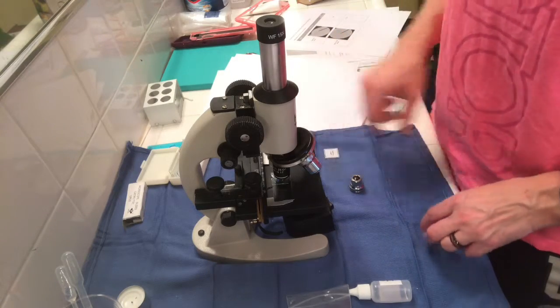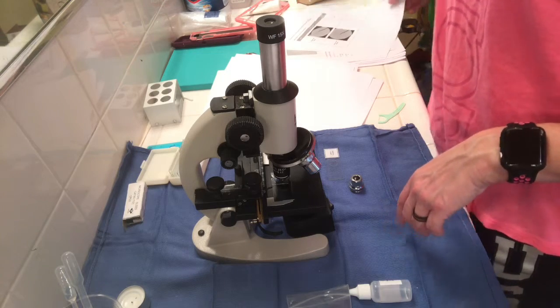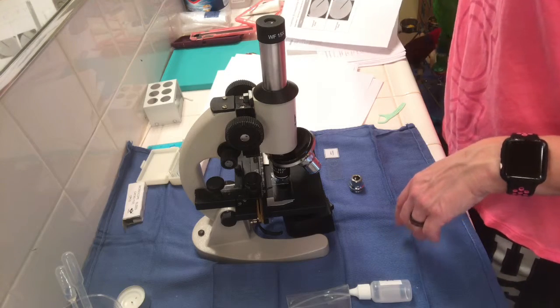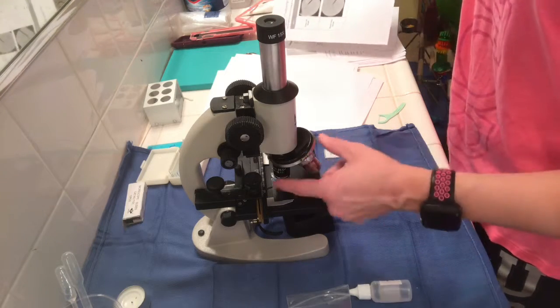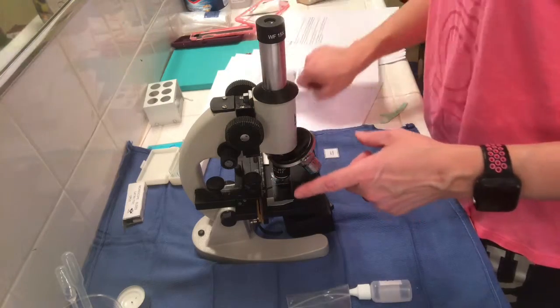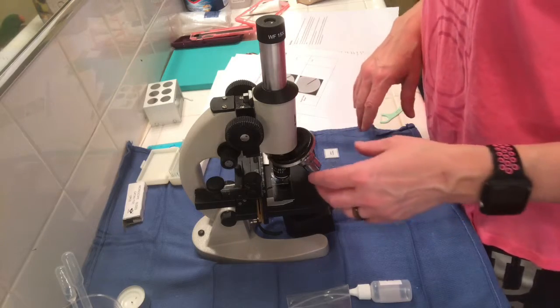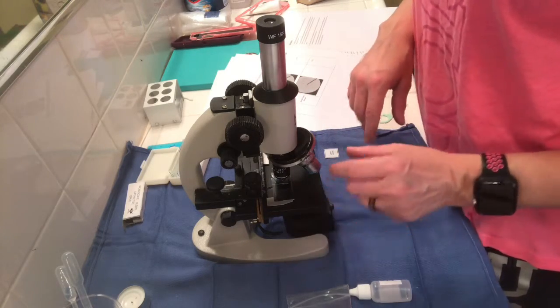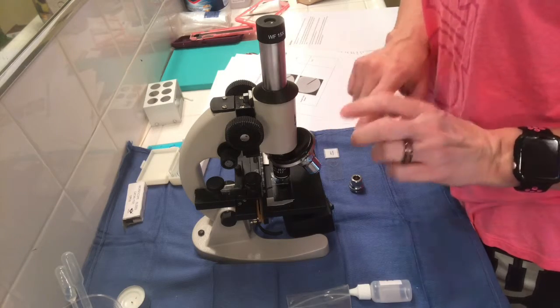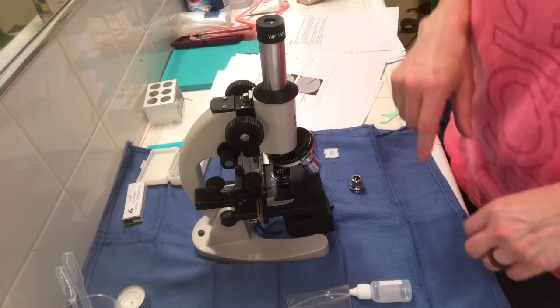because it wasn't stained, so it was hard to see my cheek cell smear and the dental tartar smear. So those were interesting to see. The best way I could see them was under the oil immersion lens, this lens right here. They were both slightly different but had similar cells, but the dental tartar smear had like little square type things that I could visualize on there, and I'll show you on the slide.